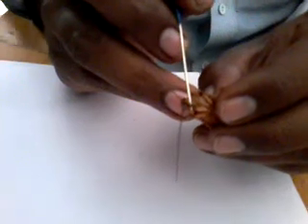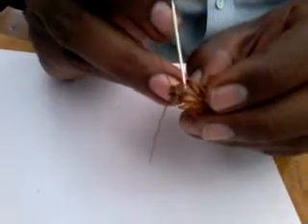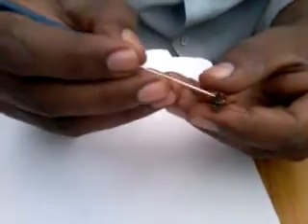Coming to the body of the cockroach: the antenna is present here — it is slightly broken but the continuation is visible. The antenna are long, slender, segmented structures. The head shows a hypognathous condition, attached at a right angle to the body. The compound eye is found here, and the antenna are tactile in function. The neck is not visible because this plate called the pronotum covers it — the pronotum is the largest sclerite of the body, whereas in the head, the frons is the largest sclerite.